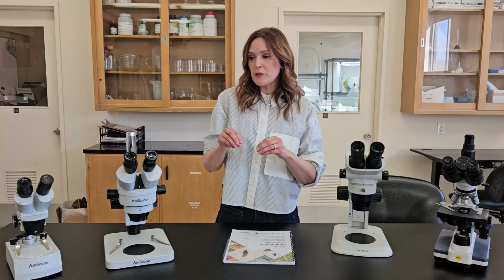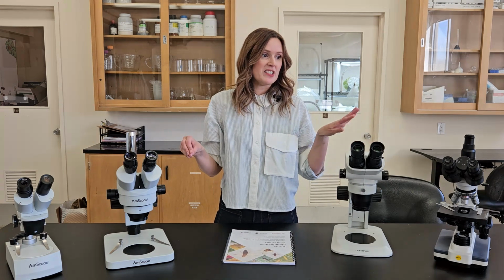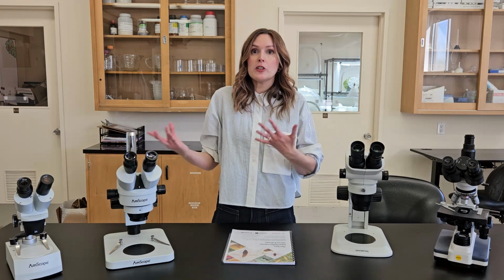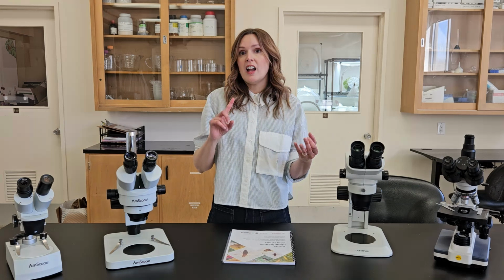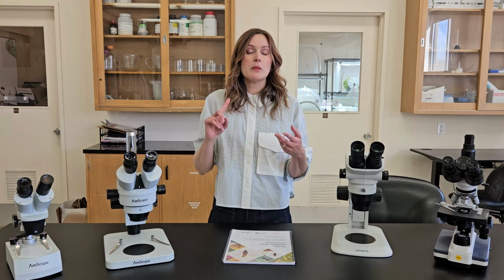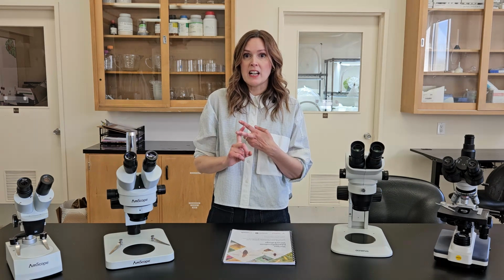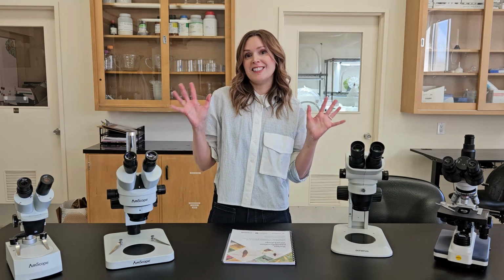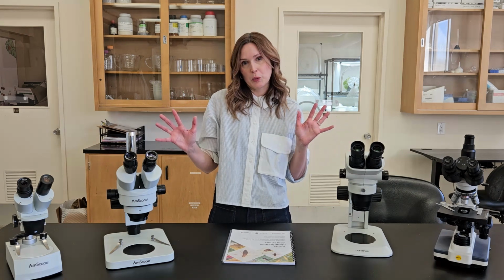So we're going to walk you through some of the different types of microscopes today. Basically this video is for anyone who might be purchasing or using a microscope: a grower, an IPM specialist, somebody working for a biocontrol company, really anyone that wants to up their insect identification game in the greenhouse world.